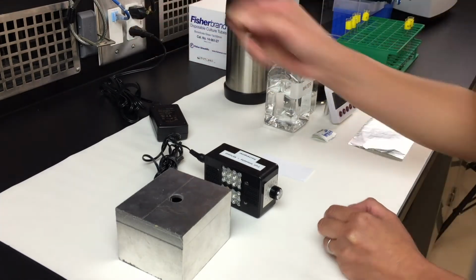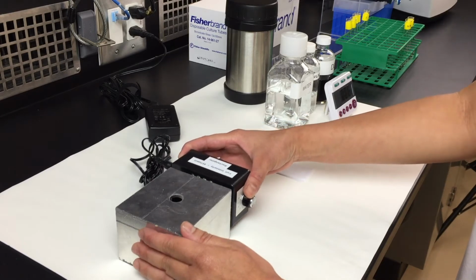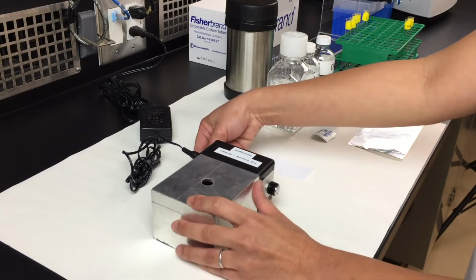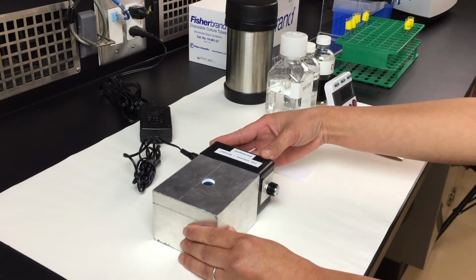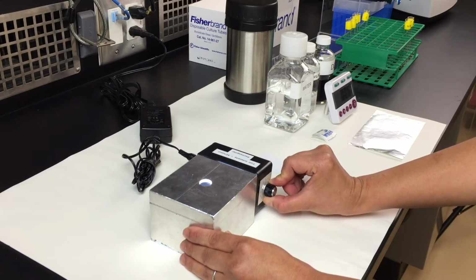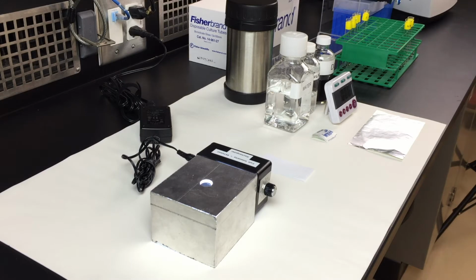you plug the light source into the source, attach the light box onto the box. In the back, there's a toggle switch to turn it on. At this moment, you should see the light. In the dial, turn it all the way to the maximum light intensity. And this would be the setting you have constantly throughout all the series in this experiment.